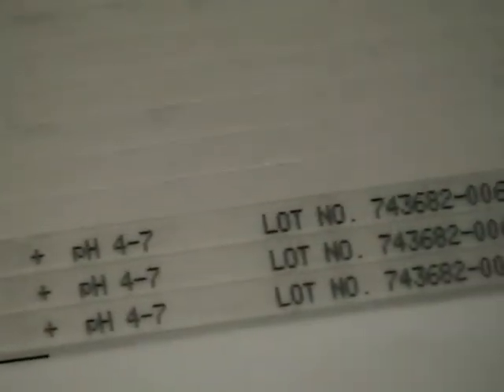What's important to understand with these strips is that the gel is fixed to the plastic surface. We can touch the plastic surface and see the written markings on it, where it says the pH gradient and indicates the positive and negative side, as well as a number for each strip. It's very important to note which strip was used for our protein samples, and the gel can be found on the other side of the plastic strip.